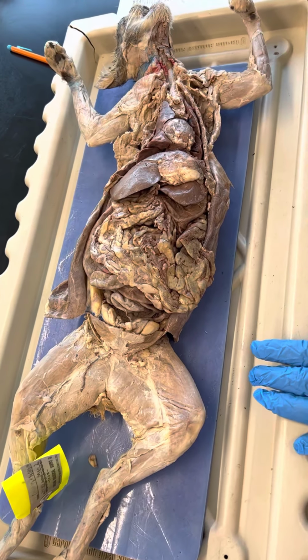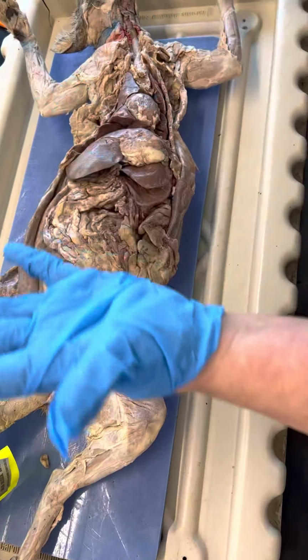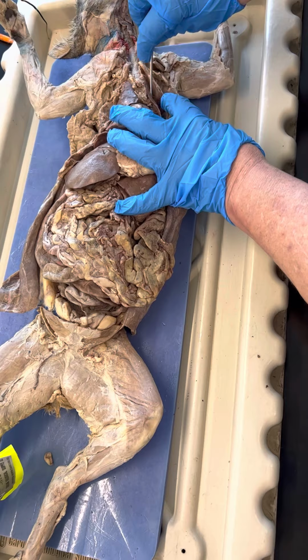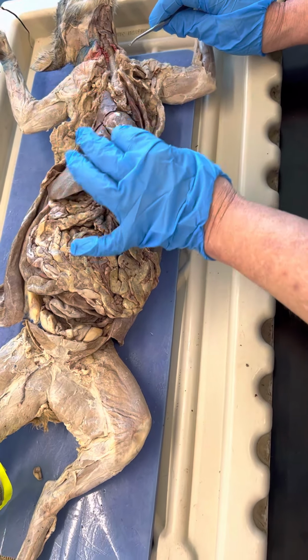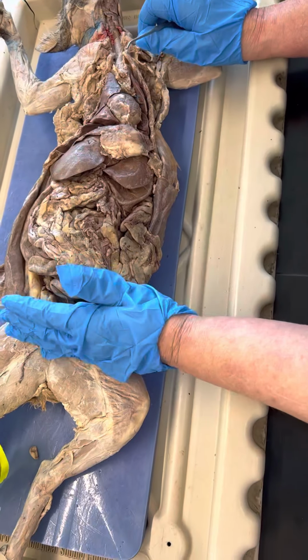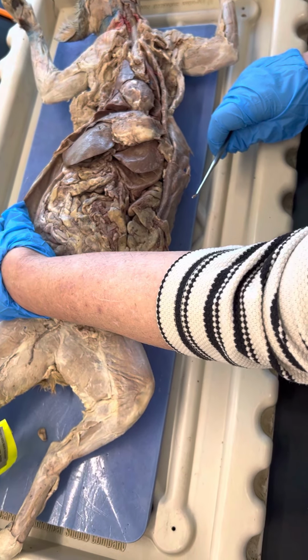So you want to start with the mesenteries. Let's just start with pleura and peritoneum. You have your pleura in your thoracic cavity. You have your parietal pleura on the body wall, visceral pleura on the lungs. The sac around the heart is called the pericardium. The diaphragm is the separation point. Down here it's peritoneum. So I'd have visceral peritoneum on the liver, the stomach, parietal peritoneum here.